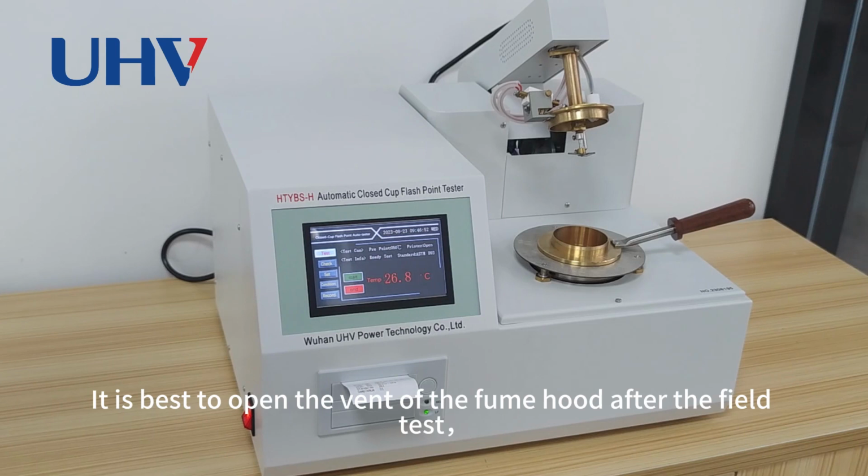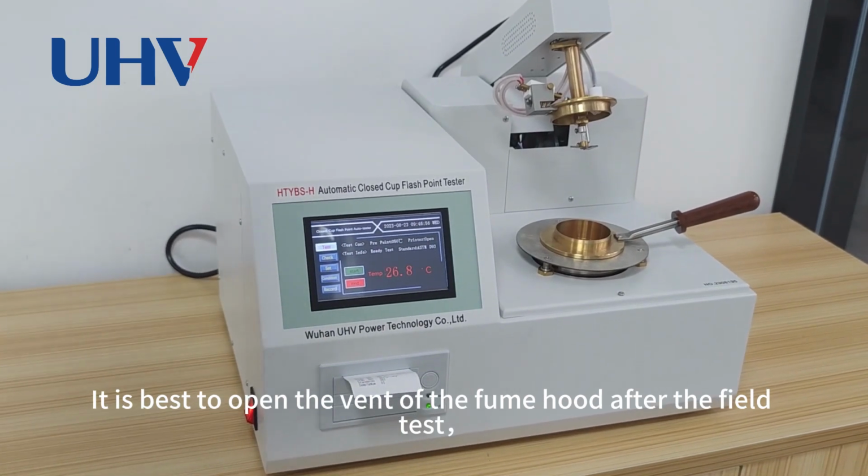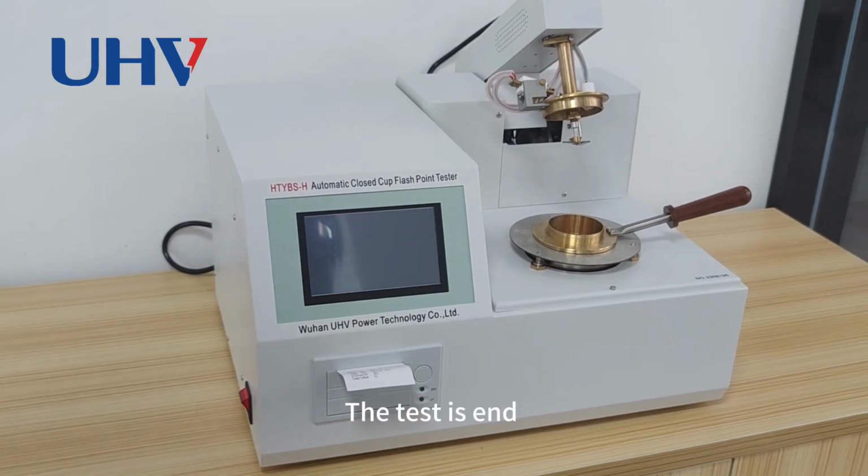It is best to open the vent of the fume hood after the field test, then turn off the instrument. The test is ended.